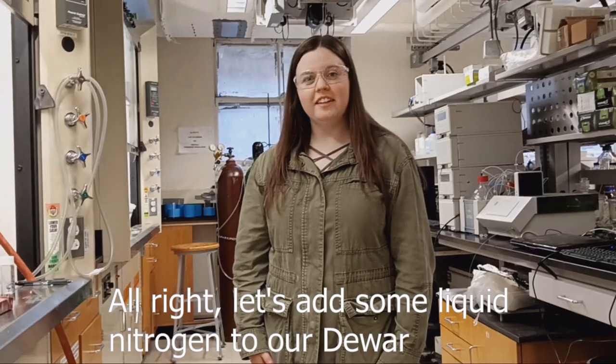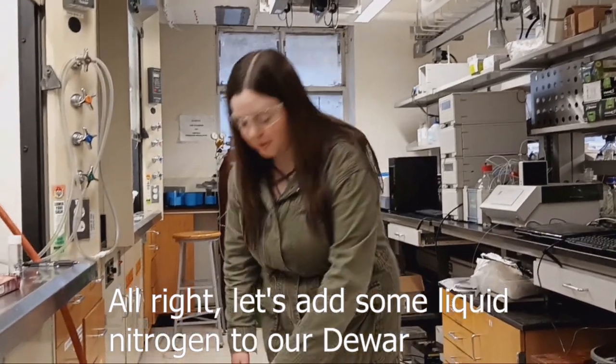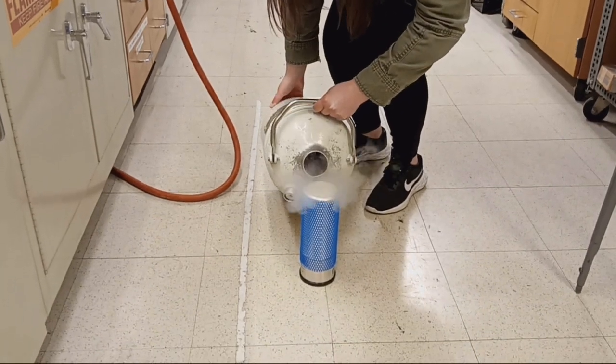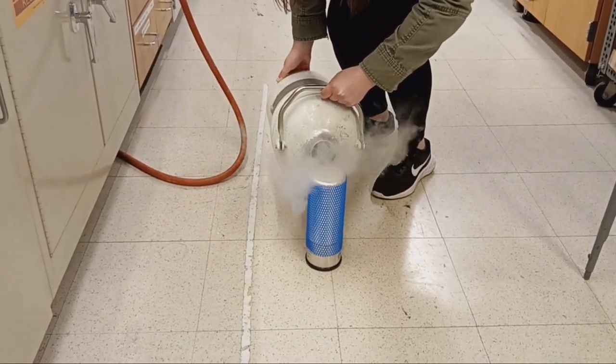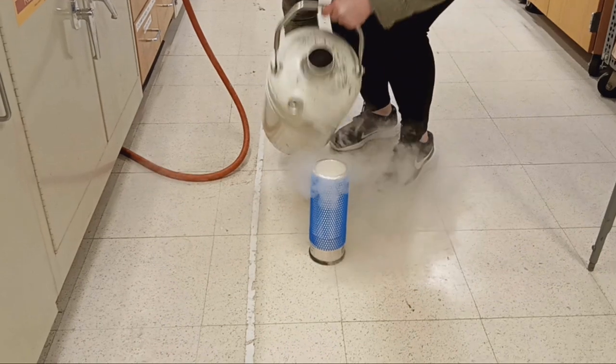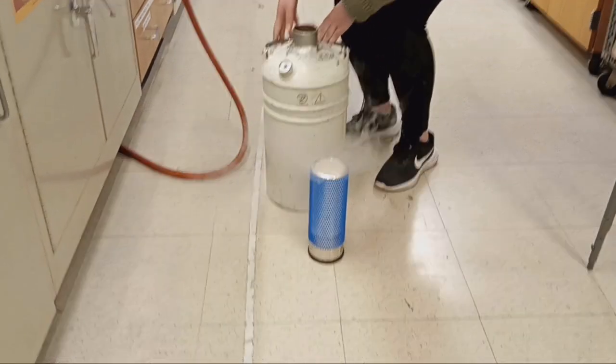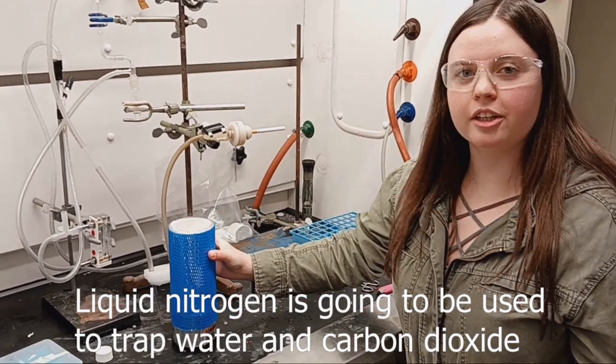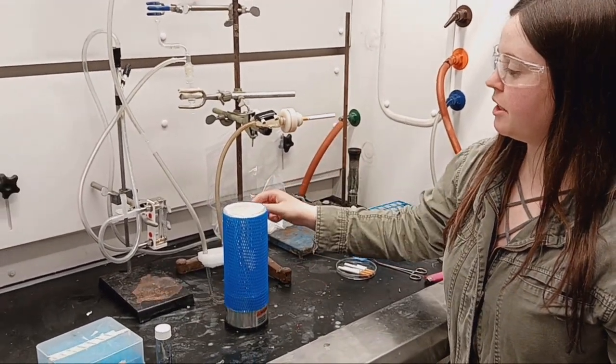All right, let's add some liquid nitrogen into the dewar. Liquid nitrogen is going to be used to trap water and carbon dioxide from burning the cigarette. The free radicals will continue to travel through the tubing.